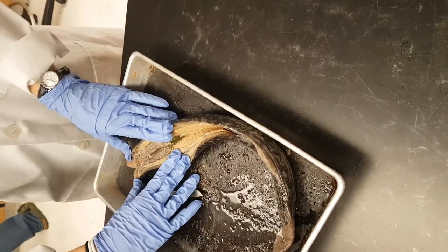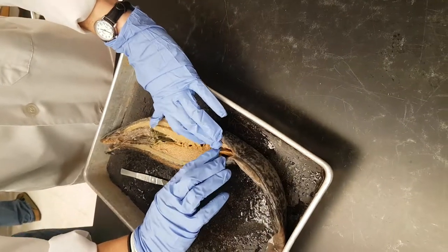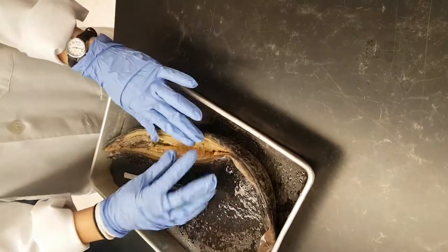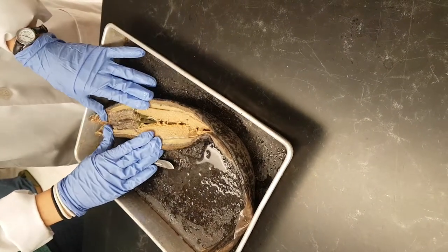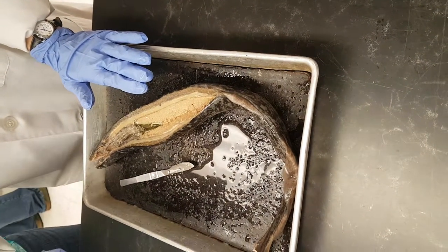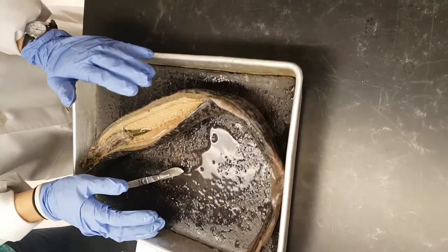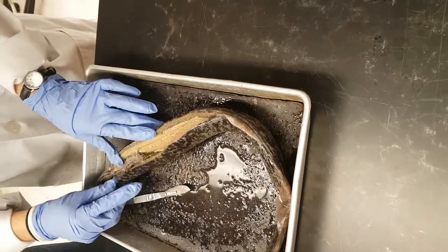You guys are going to have to be careful up here because you have all the teeth, so that makes it a little more difficult. I'm just going to do the internal structures because the external structures are pretty simple and I kind of cut through some of them.